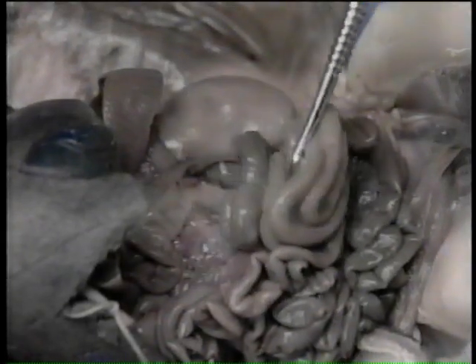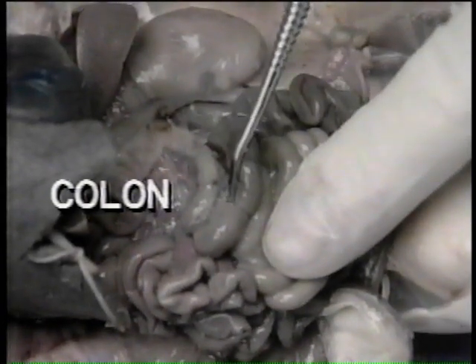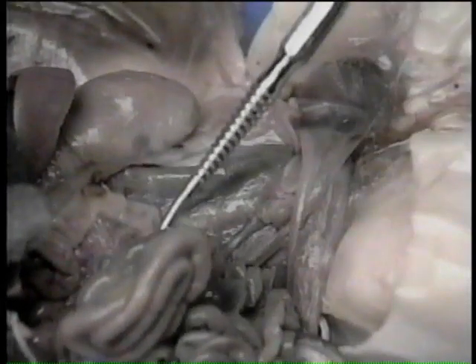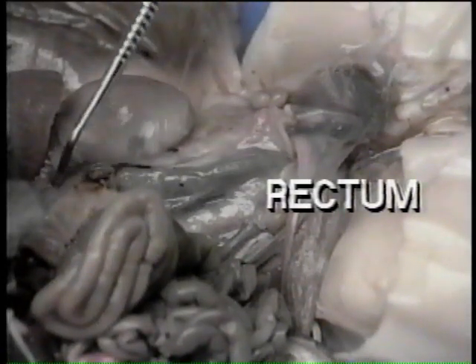As observed earlier, the cecum is the first part of the large intestine. The compact coiled mass following the cecum is called the colon. The caudal part of the large intestine, continuing from the colon, is the rectum. It terminates in the anal opening.